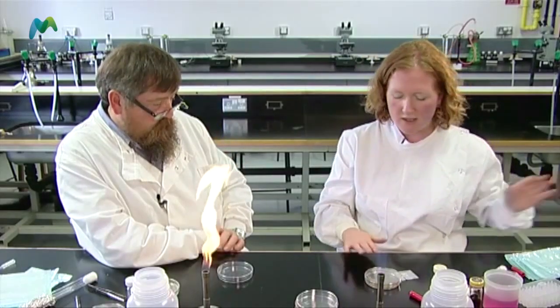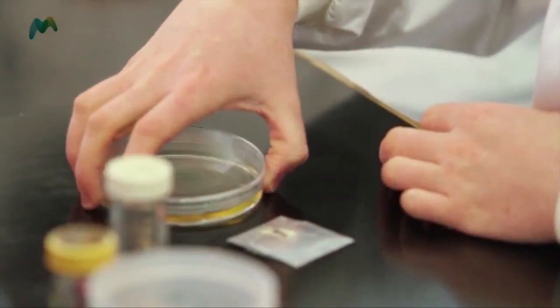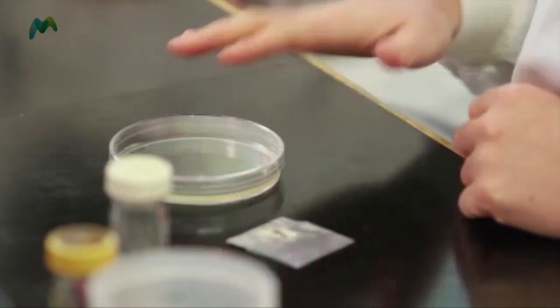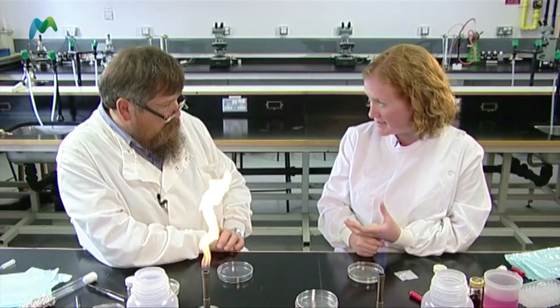Normally we would sit and wait for this to set, but I don't have time just now. So, handily, I have some nutrient agar just here with some E. coli culture already through it, and I've labelled it as such. What we're going to do is take some sterile filter paper discs and infuse them with some disinfectants. I've got four different things that I want to use today.